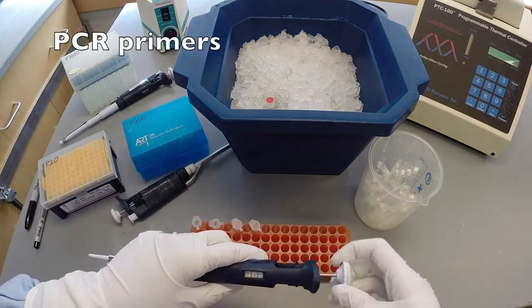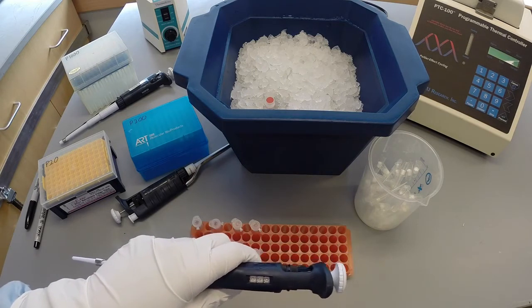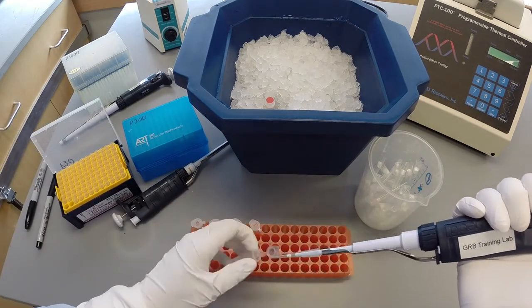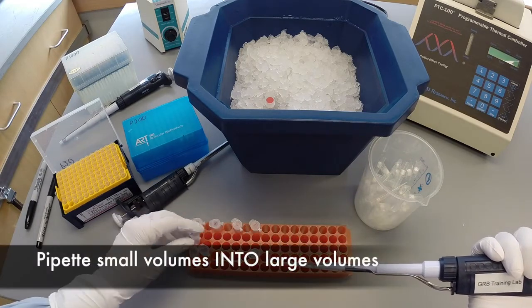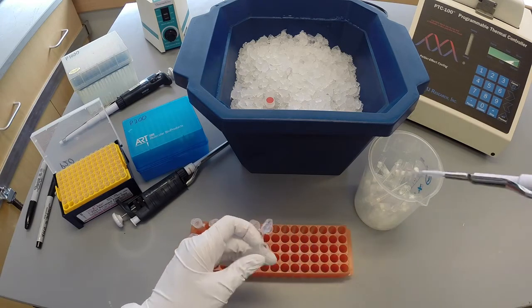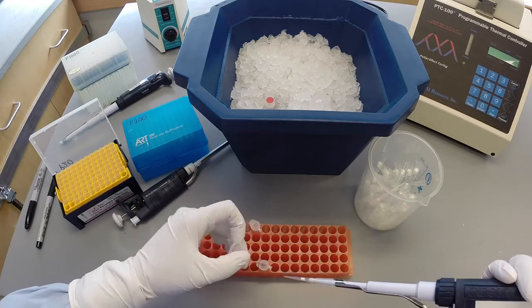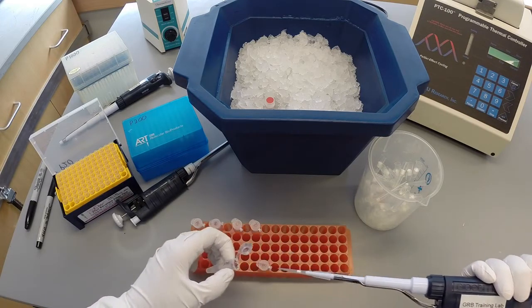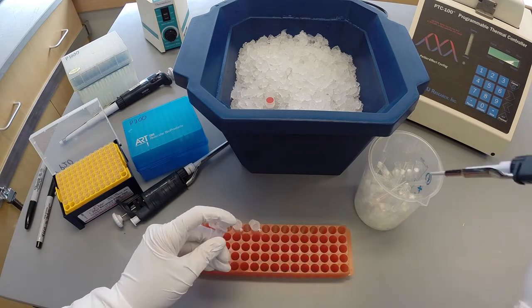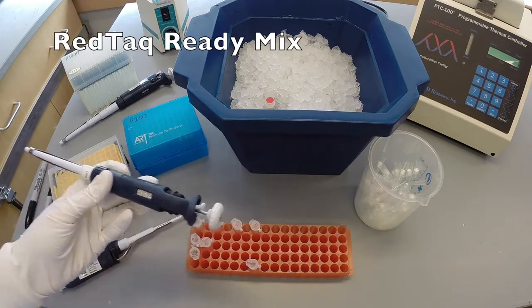Next, the primers are added. It is best to pipette small volumes directly into larger volumes to avoid loss of the reagent. Finally, add the RedTaq and immediately return the stock to ice.